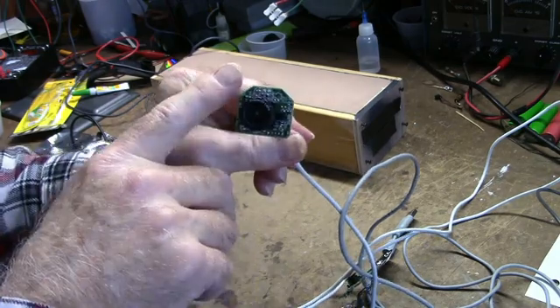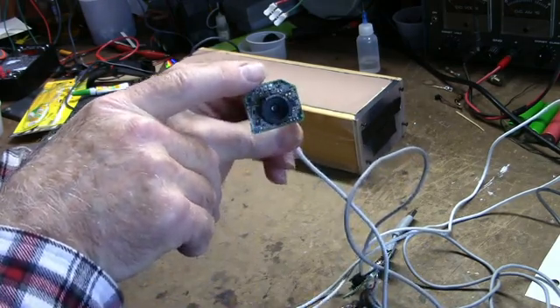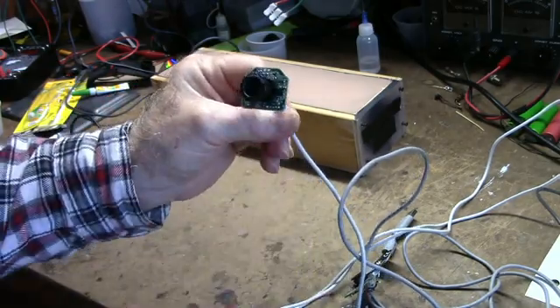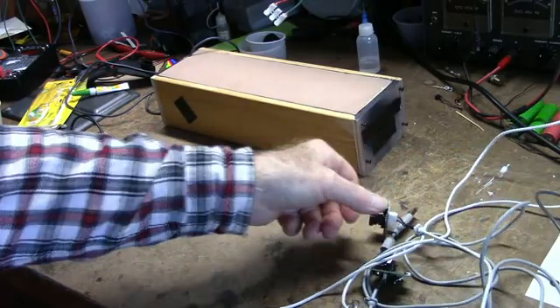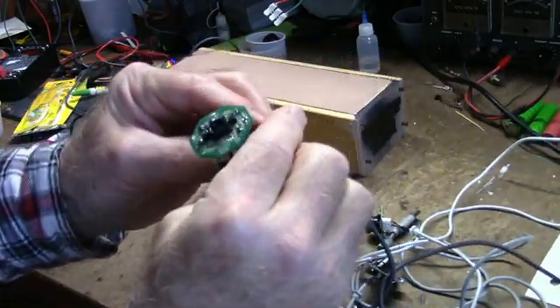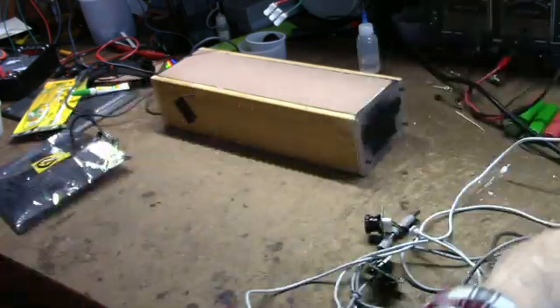You have to disable the LED, which is just by unsoldering it. You don't want the visible LED to come on when you're using this thing. And also I removed a microphone on it. And there's different styles. Here's another one that I removed the filter. You have to be real careful.